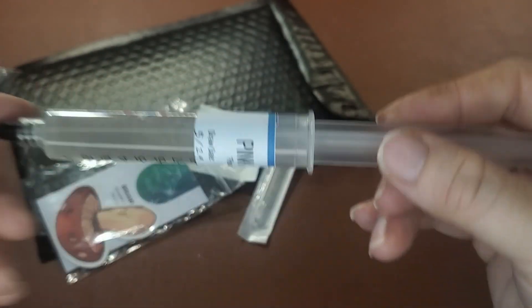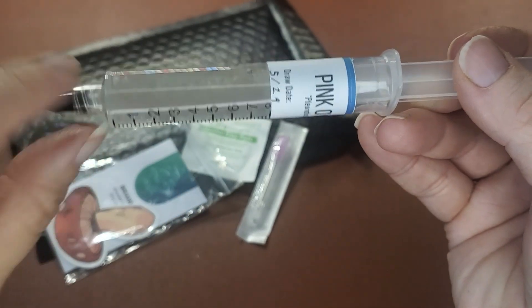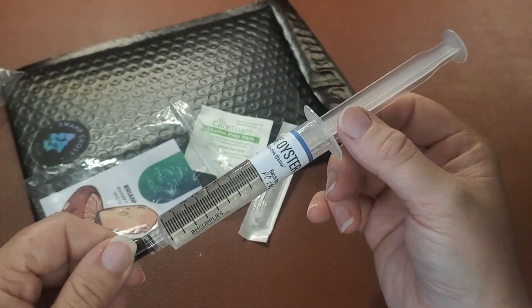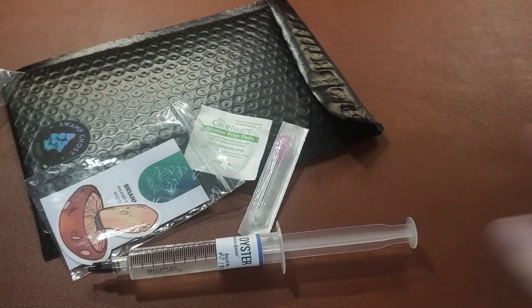I'm on a kind of a funny ring light situation right here, but if you can kind of see right in here, this is full of what kind of looks like a white aloe drink. That's the mycelium — that's what's actually going to grow your mushrooms. We're going to inject some of this into a sterile grain bag.